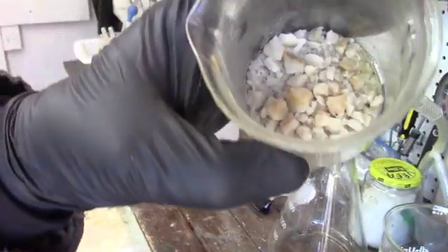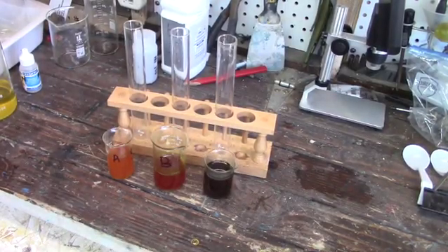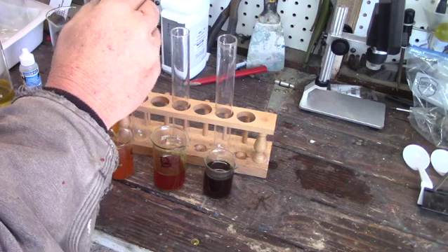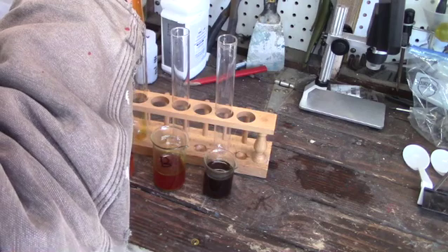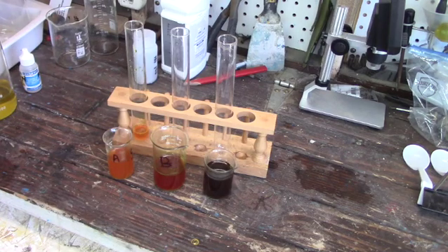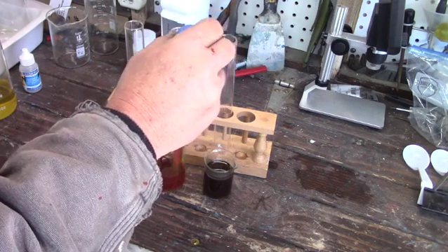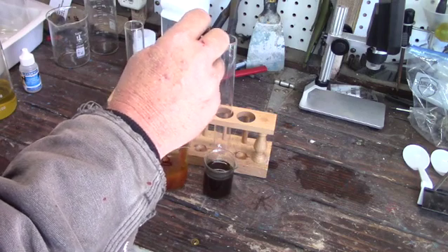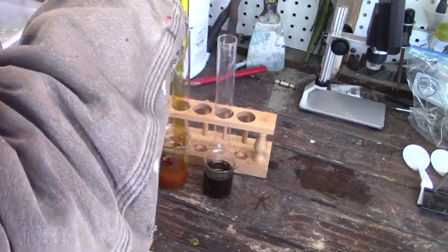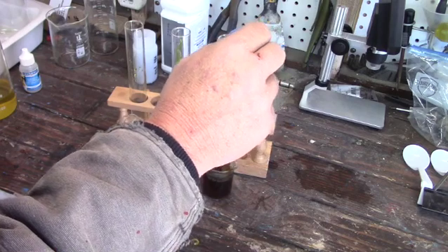And this is what we've got left over — here are some nice clean shiny rocks. Here are the three filtered and cleaned samples. We're going to take six milliliters of each sample and place it in a test tube for testing. You can tell I'm a professional — I have a test tube rack with test tubes. That's how you know if you're a real scientist.